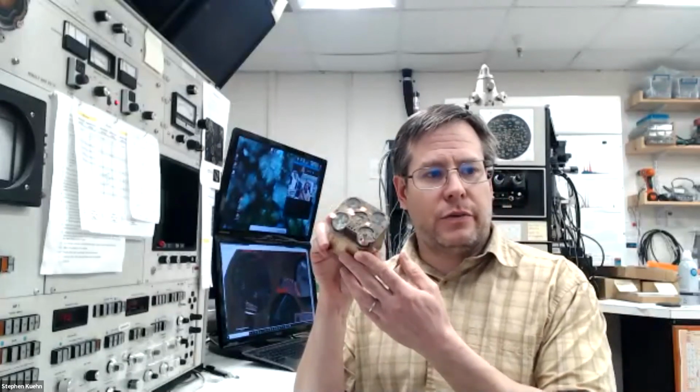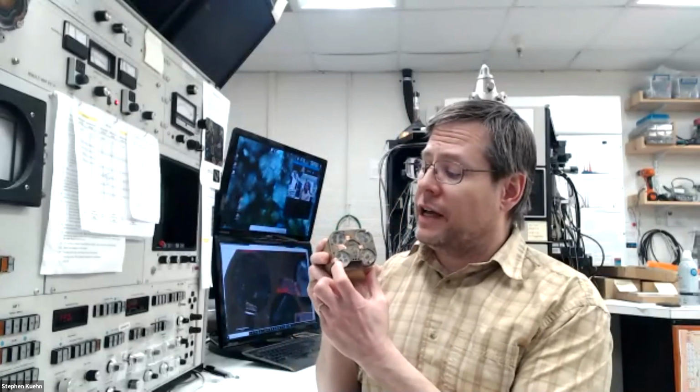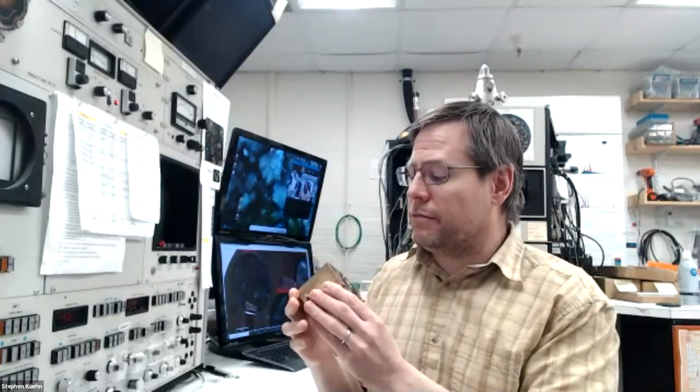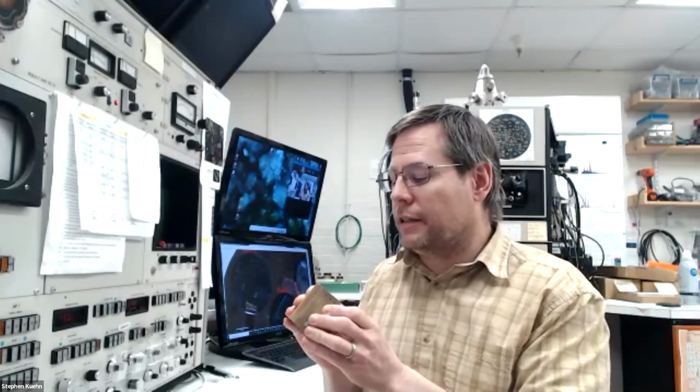So this is one of these little brass holders. We have 3 or 4 of them. We put the samples in. And the one that's in the microprobe right now is the same one that we had last week. The lower left corner, which would be this position, had the one with the little mount with all the minerals in it. And then there's 4 other positions, and they also have igneous rocks in them. The one I'm holding actually has other stuff. It's volcanic ash and whatnot.